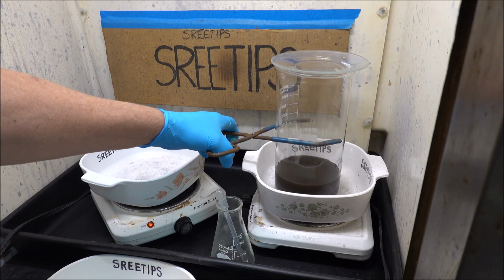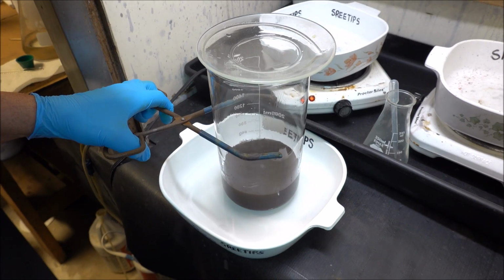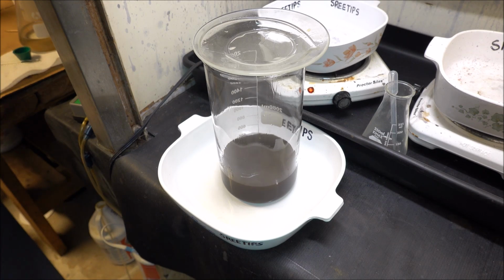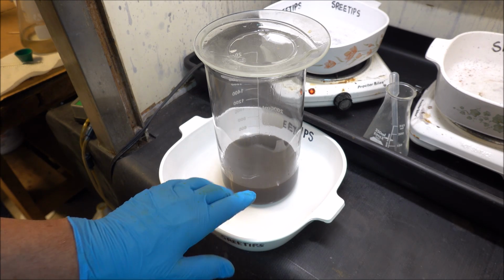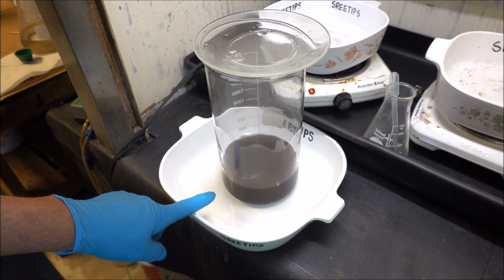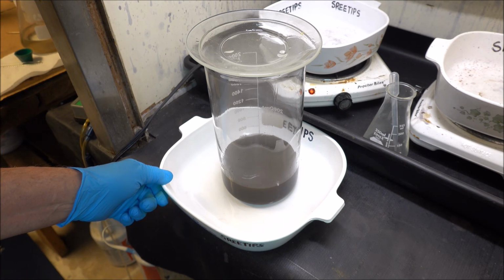I've been working on this for several days now, and as you can see, the chunks of gold have come apart and formed a powder that stays suspended in the liquid. So what I'm going to do now is let this settle, and then I'll draw this liquid off. This is one of the problems that occurs if we add too much silver or copper, whatever the case may be, to inquart the gold.